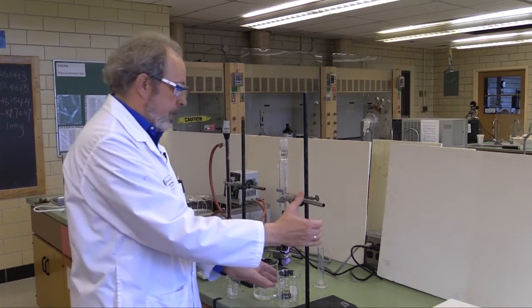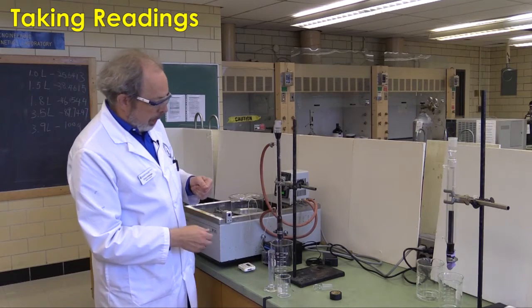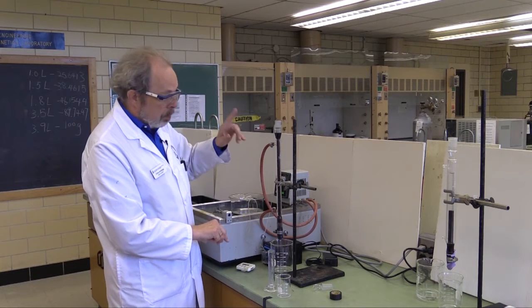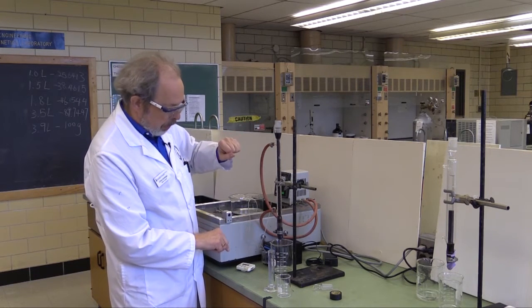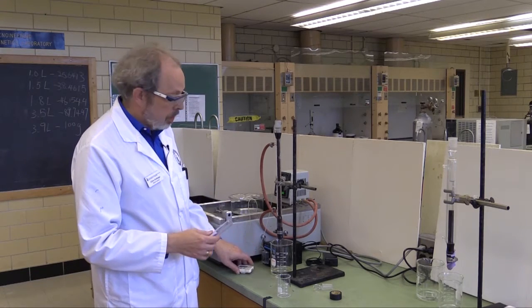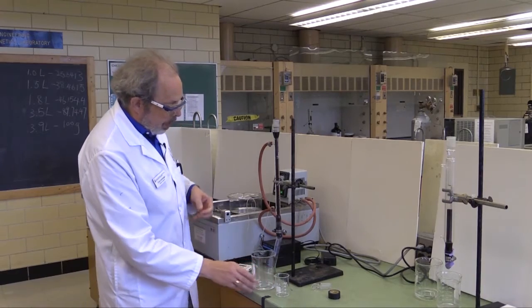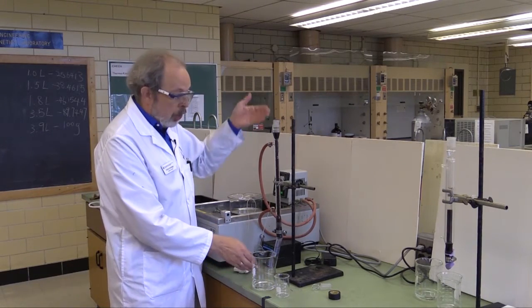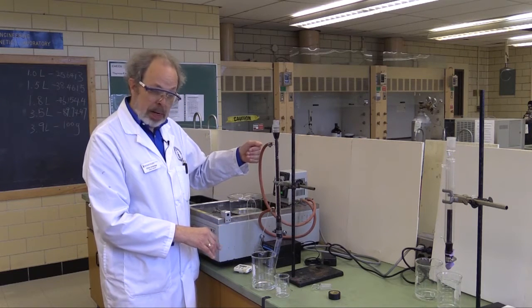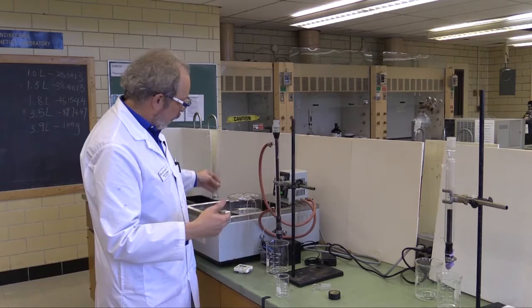Now, I'm going to put this to one side, and talk about taking readings. Let's assume that this reactor is almost long enough. Notice that I've actually got rather too much water in here, so I can slow the pump down. But do keep watching to make sure that there's enough liquid in here all the time. I do need to have an idea of how fast the water is coming through. So, with a timer, or your cell phone stopwatch, for a control period, say three minutes, put a graduated cylinder under there so that you know how many mills of water runs through the reactor in a given period of time. This is probably going to be two minutes would give you a decent volume. So, you need to do that at some point in the half hour while it is coming to steady state.